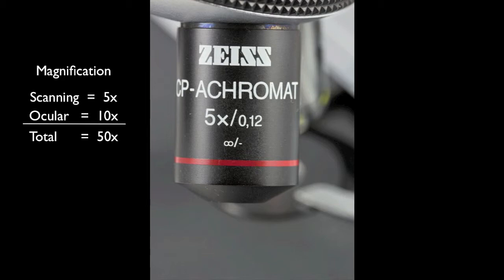Once you have located your object, use the mechanical stage knobs to move it to the exact center of your field of view, and make sure that it is in perfect focus before turning the next objective into place.